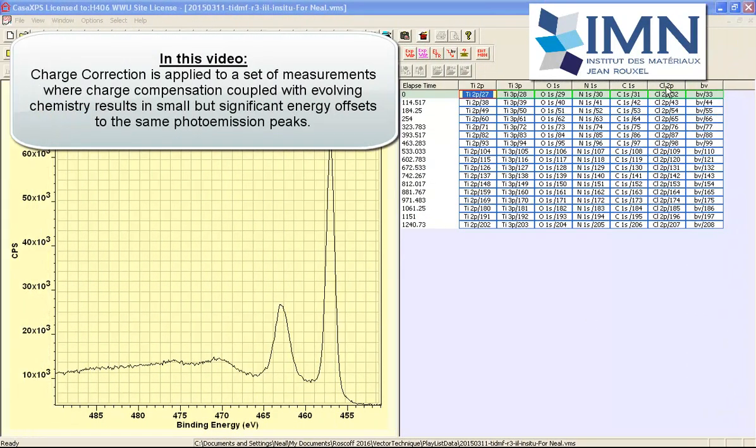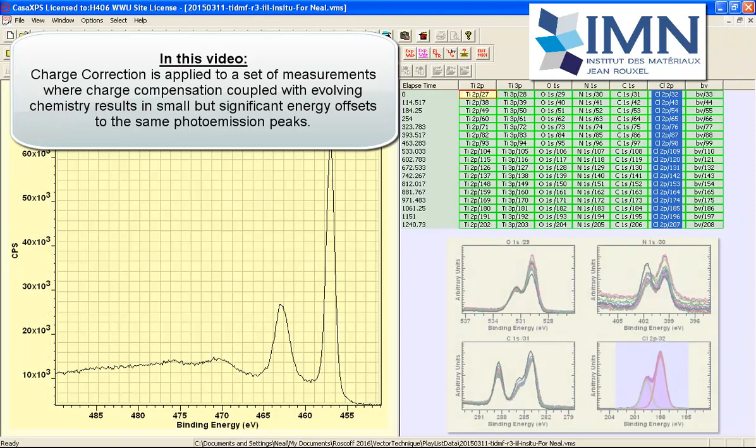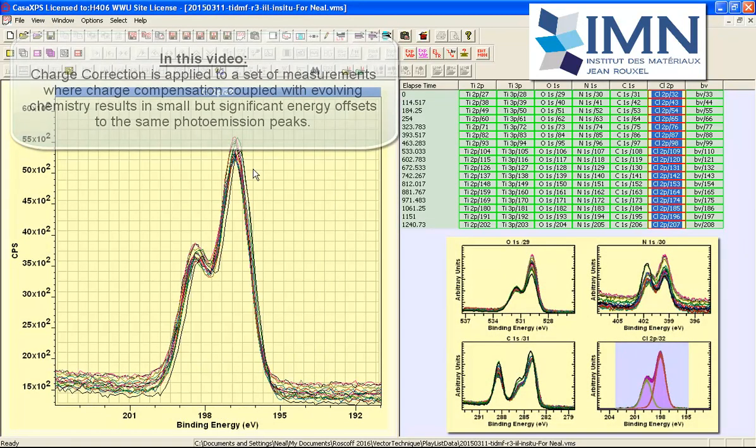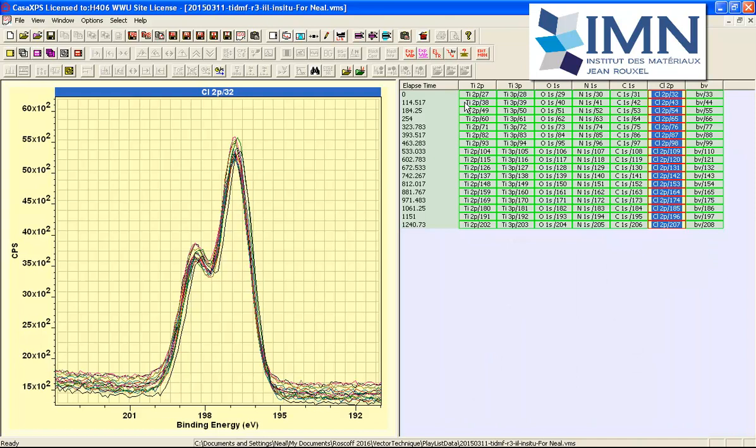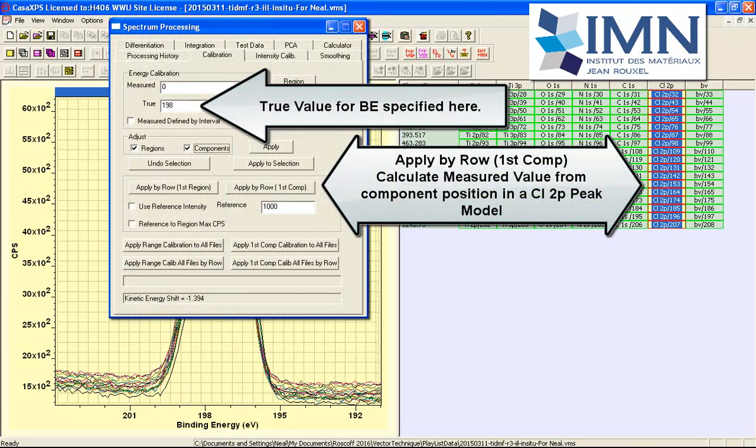In this video, we're going to look at how charge correction can be performed based on one column of VAMAS blocks that have a well-defined binding energy, and how this correction can be applied to each row within a file. This is intended to correct for charge compensation that is not identical for each one of these measurements.